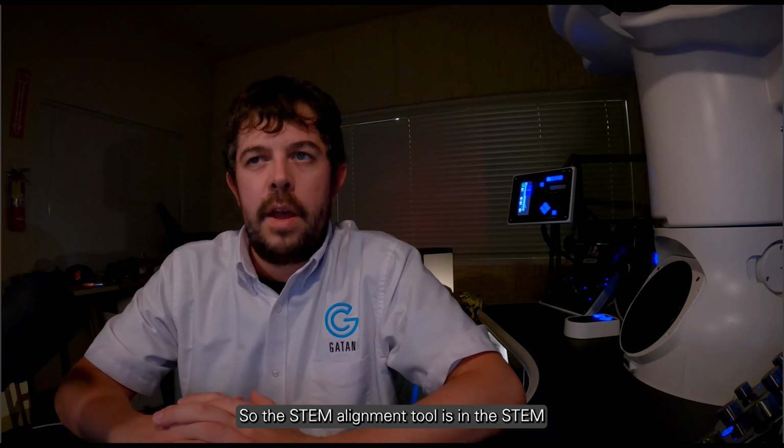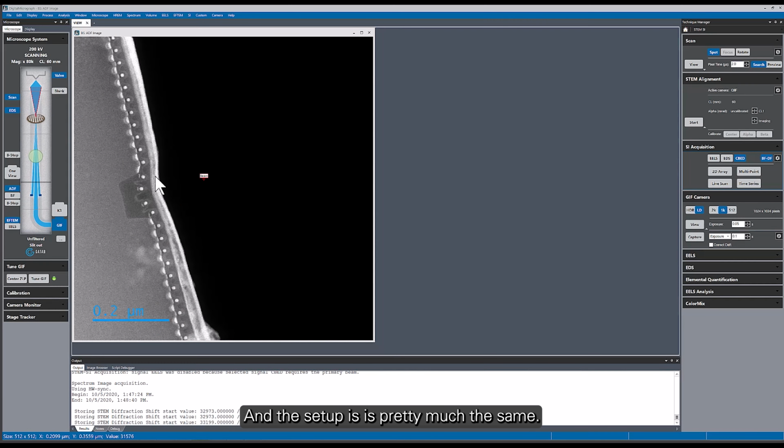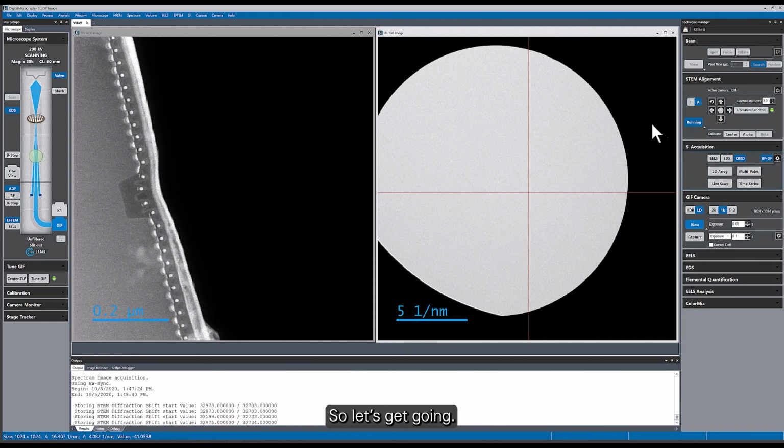The STEM alignment tool is in the STEM technique and the STEM SI technique. So I'm back in the STEM SI technique, and we're looking at the same sample as for the diffraction module. We're looking at the semiconductor device again, and the setup is pretty much the same. I've taken the small aperture out that we were using for diffraction, and I've put the very large aperture back in. So let's get going.